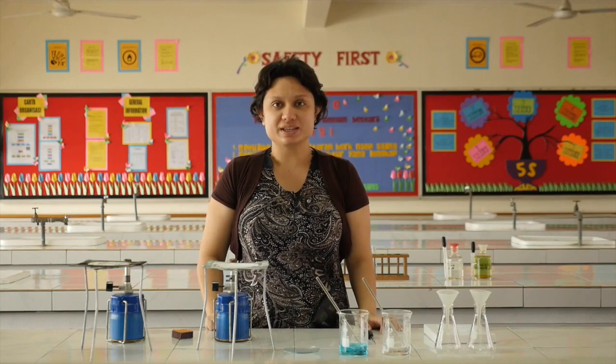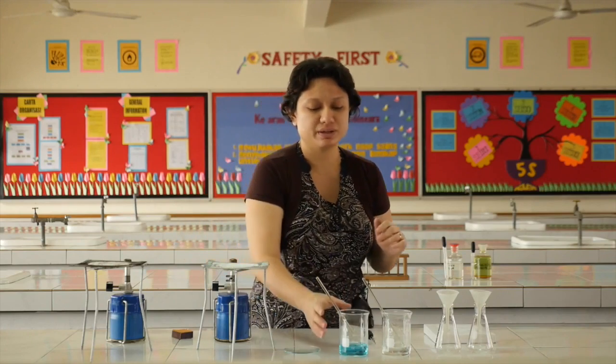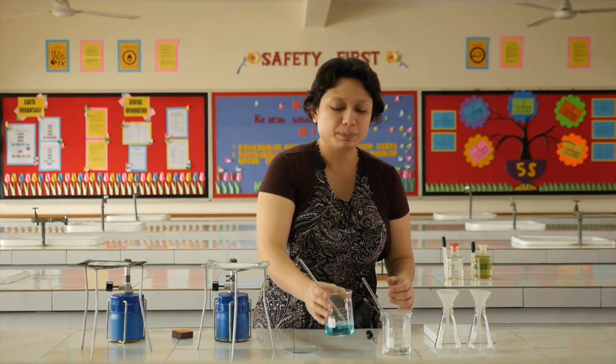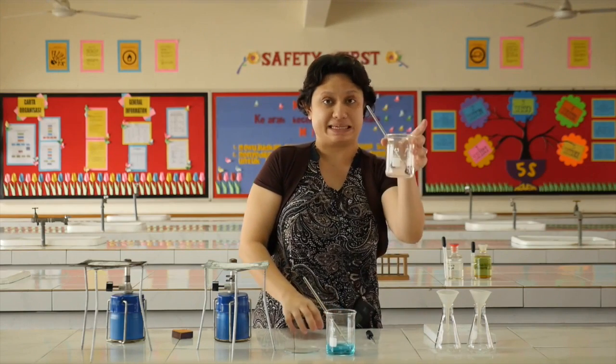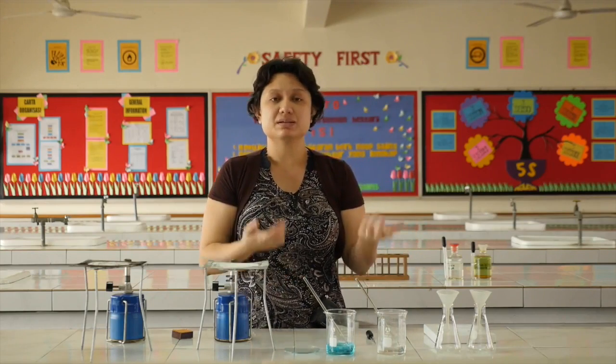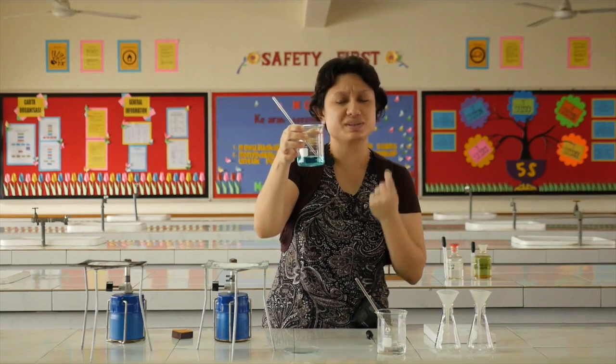Hi kids! What we're going to do today is crystallization. Now, if you remember from our previous experiment, we prepared a salt solution of copper 2 sulfate and a salt solution of potassium chloride. Now, if you use these chemicals in your lab, you will notice that they don't use solutions. Instead, they come in powders. No one is going to sell solutions to you. So how do we change the solutions into crystals?